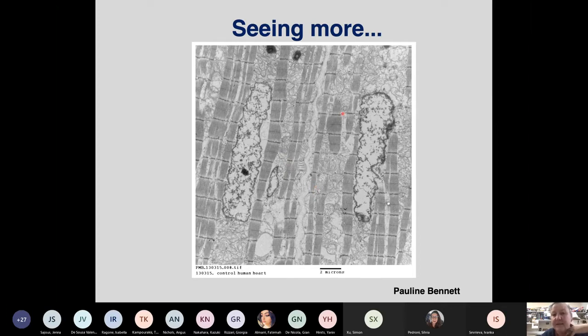have suffered a bit is that this is actually an electron micrograph of a human heart sample that had been sitting in liquid nitrogen for a while. So, I mean, it's amazing that it looks that good for what it experienced.